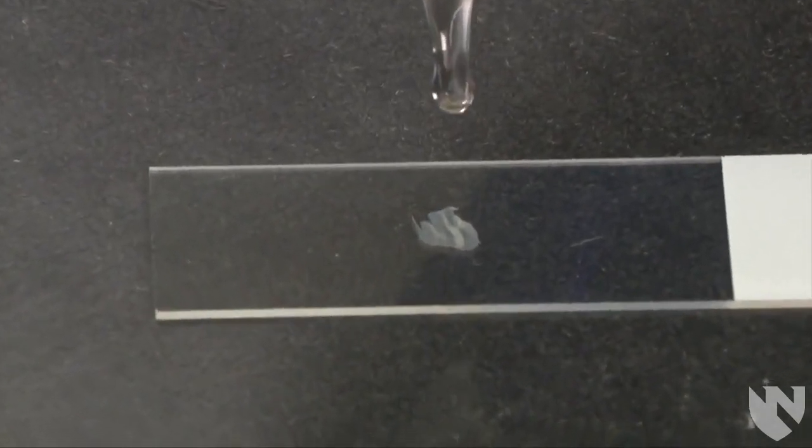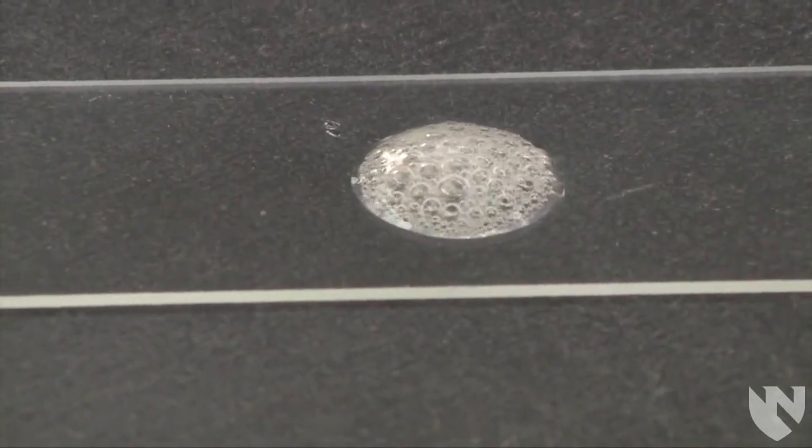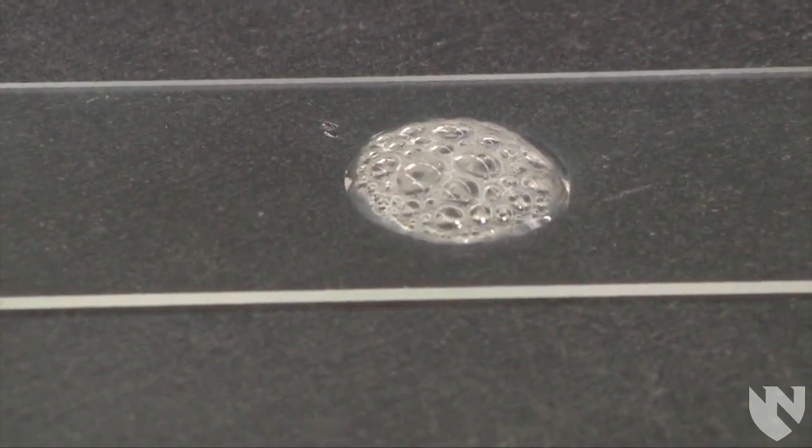Immediately observe the slide for production of bubbles. A positive catalase demonstrates vigorous bubbling. The bubbling should be vigorous and immediate as you see here.